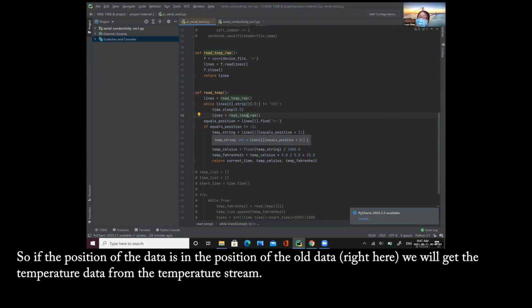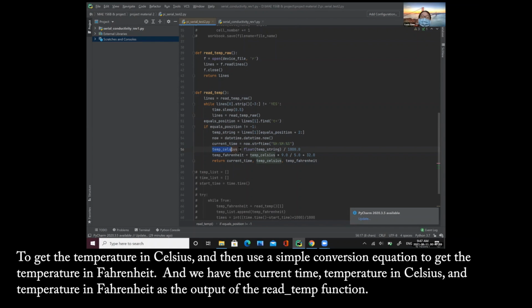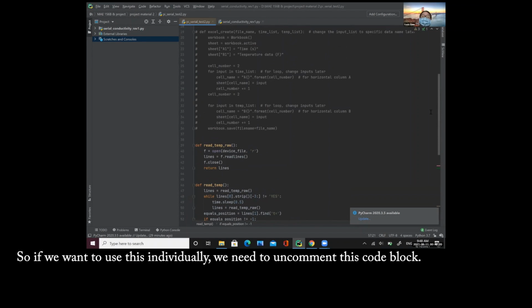So if the position of the data isn't the position of the old data right here, we will get the temperature data from the temperature string. And these two lines are to find the current date and time and limit it to only the current time, which is shown in hour, minute, and second. We get the temperature in Celsius, and then use a simple conversion equation to get the temperature in Fahrenheit. And we have the current time, temperature in Celsius, and temperature in Fahrenheit as the output of the read temp function.